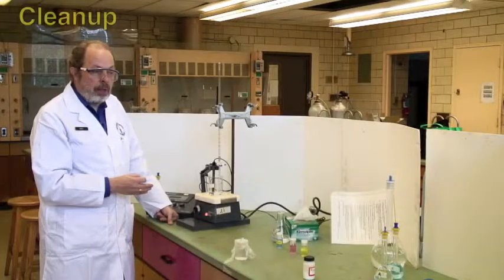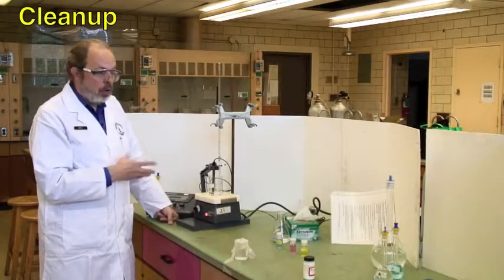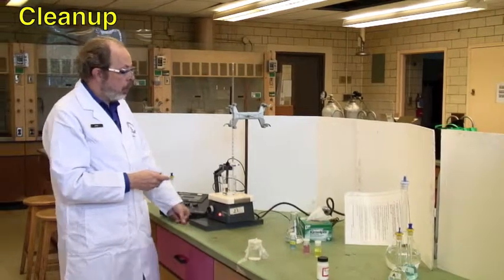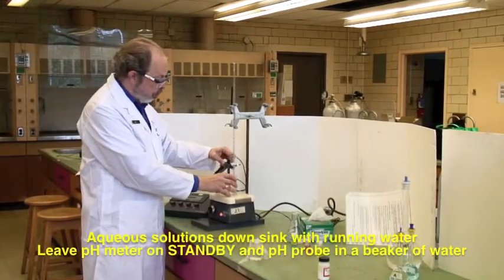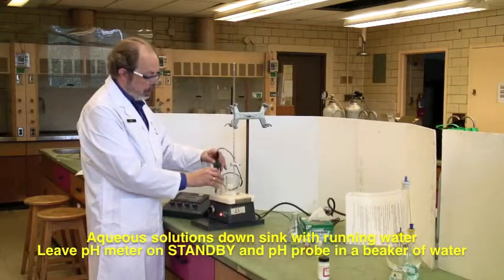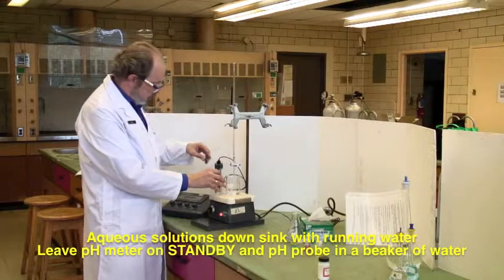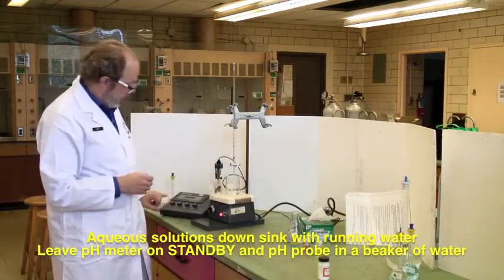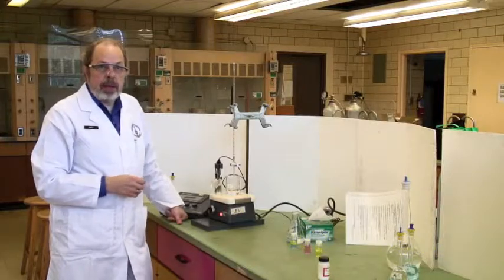For cleanup, all solutions can go down the sink with plenty of running water. When finished with the pH probe, place it back in the beaker of distilled water where you found it, and ensure the pH meter is set on standby.